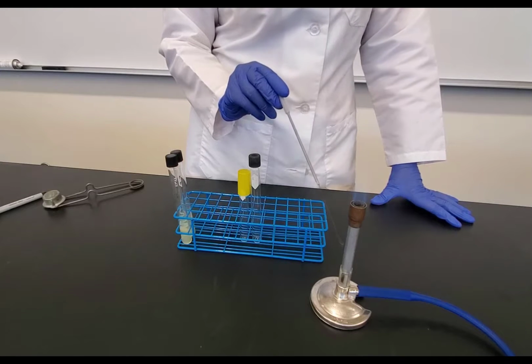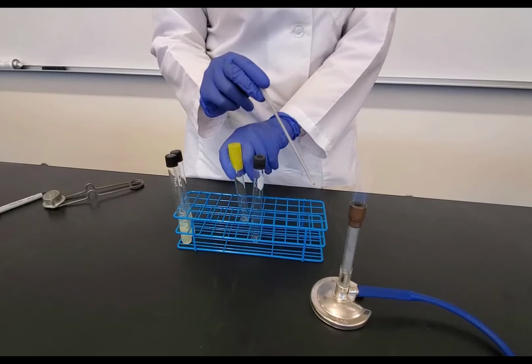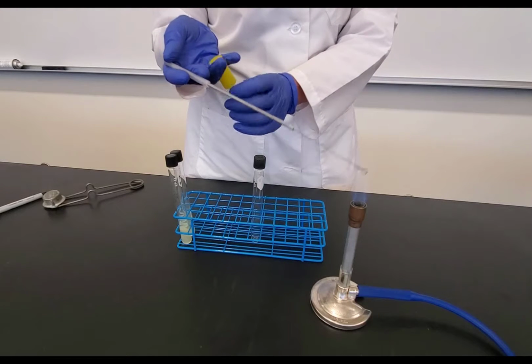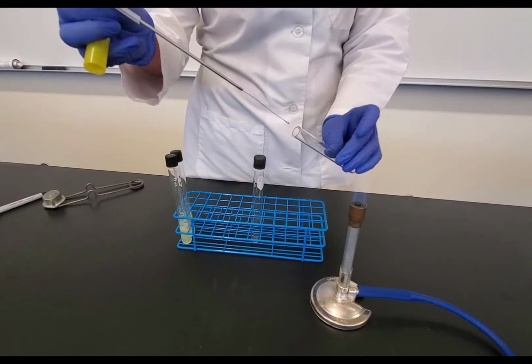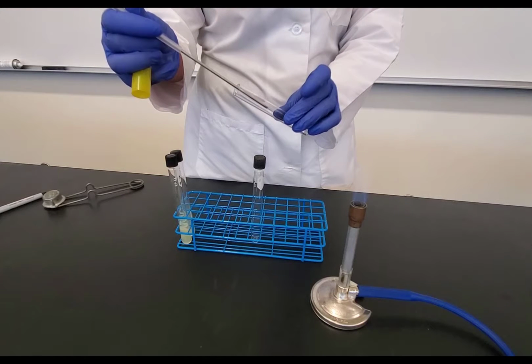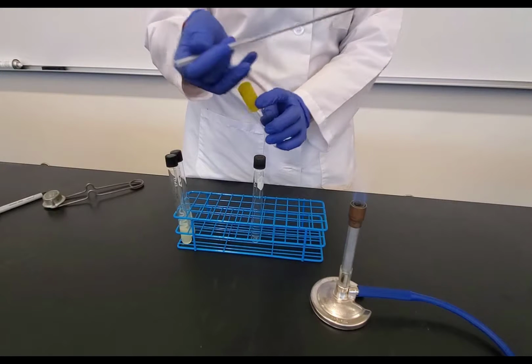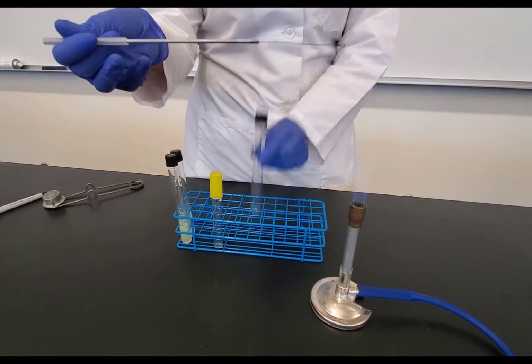Now I'm letting it cool by holding the loop close to where the flame is. That's my sterile field. I'm going to pick up my tube that has my bacteria. Again, this is a simulation. I hold the cap between my pinky and my ring finger. I flame the opening of the tube, and then keeping my loop hand as steady as possible, I bring the tube to it to pick up the bacteria. I flame the tube and I put the cap back on. Then I set that down. I move it in my rack so that I know that I'm done with that tube.